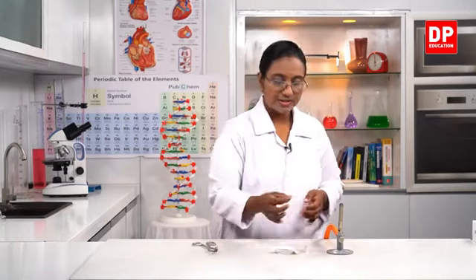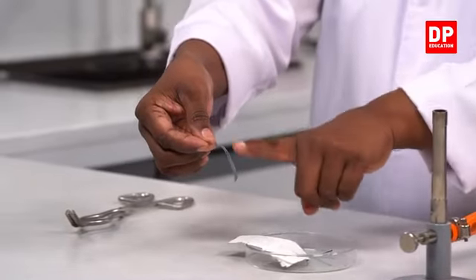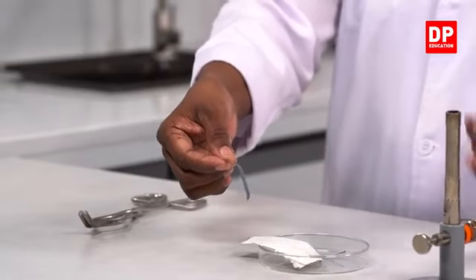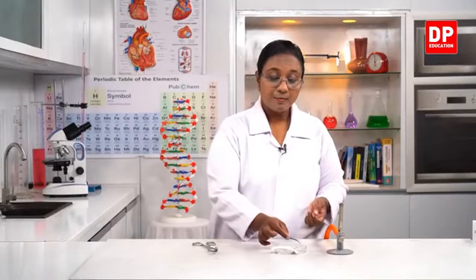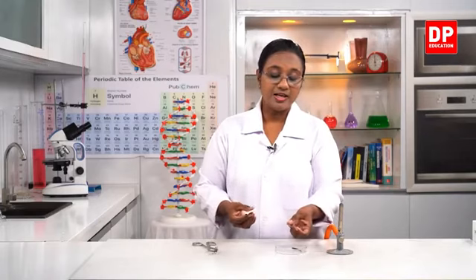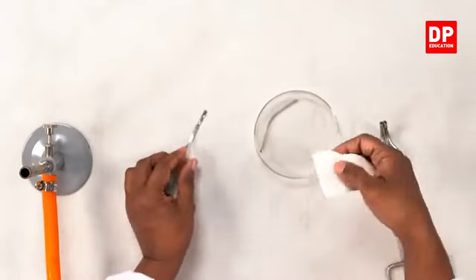Now here you all can see normally we have a magnesium strip in the lab. If you look at this, you have learned this before also in one of the previous lessons. There will be a layer formed over the magnesium strip. Although it's a metal, we don't see the shine. The lustrous nature is not visible. But we can clean that using sandpaper. Now I have cleaned it to a certain extent. Now in these areas you can see the shiny nature, but it has to be cleaned a little bit more.